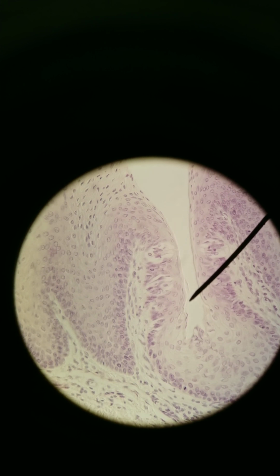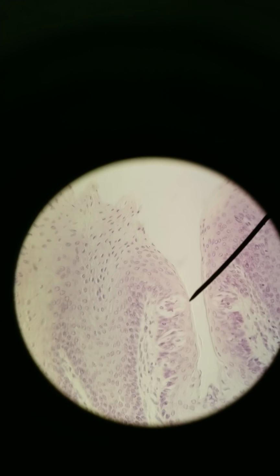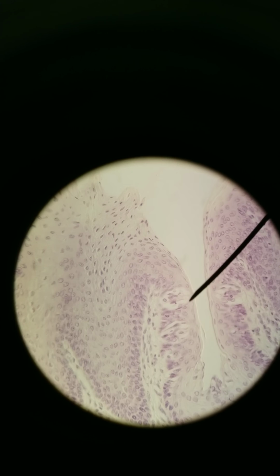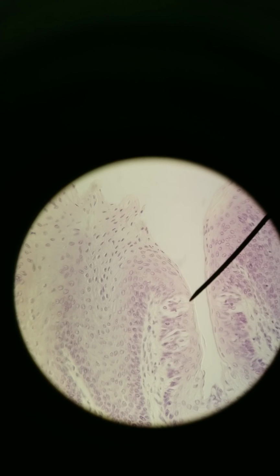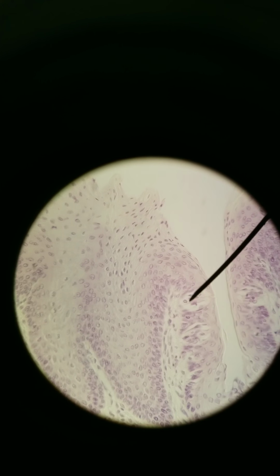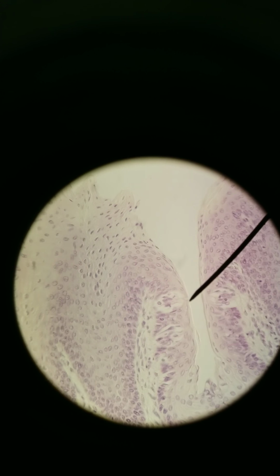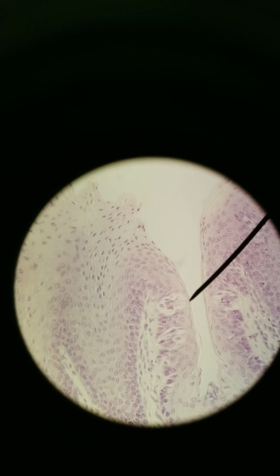pores, it's called a taste pore, we see these lighter colored cells forming a circle, a circular structure. There's actually several cells from here down to here. You can see, like, here's one nucleus, here's another, here's another, here's another. There's a bunch of cells all packed in together, and there's a tiny opening, this taste pore right here, a tiny opening to the outside, to the apical side.